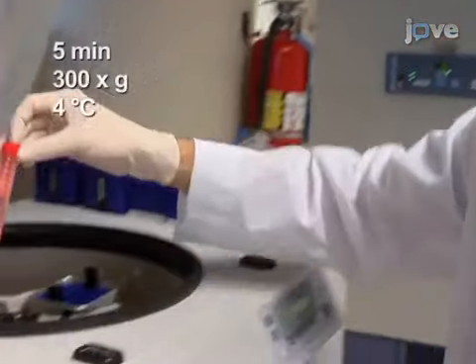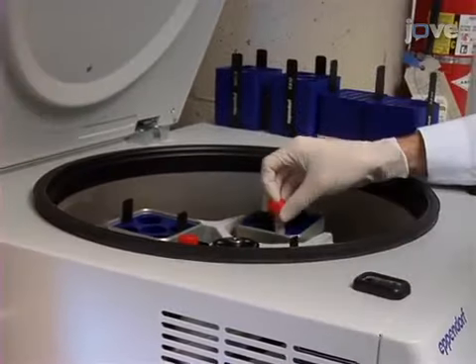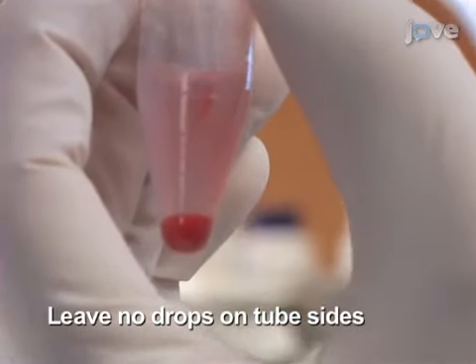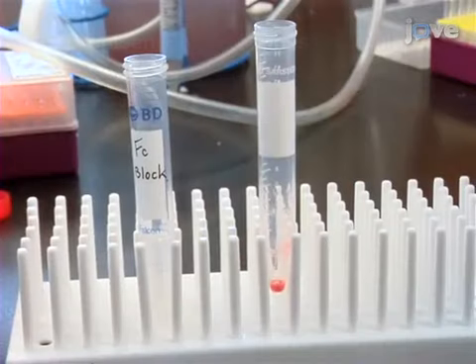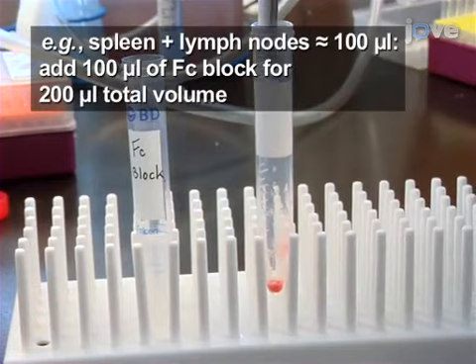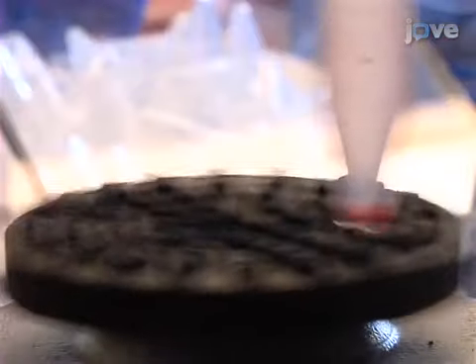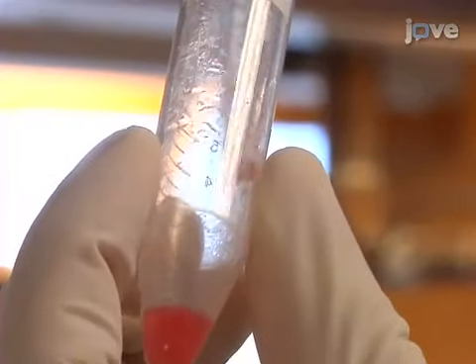After adding cold sorter buffer to a final volume of 15 milliliters, centrifuge the tube for 5 minutes at 300 times G and 4 degrees Celsius. Then carefully aspirate the supernatant. Resuspend the cell pellet in FC block to a final volume equal to approximately twice that of the pellet itself. If a large degree of cell clumping has occurred, carefully remove the cell clump with a pipette tip.